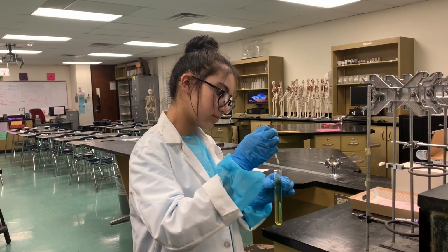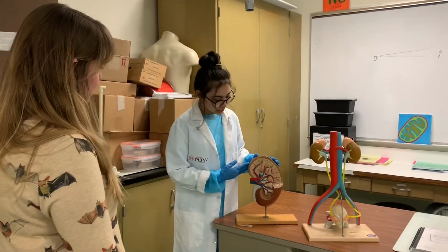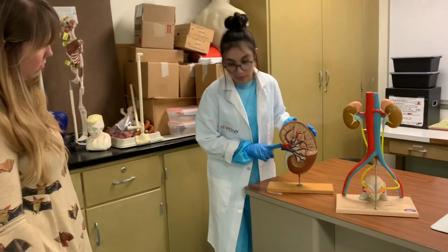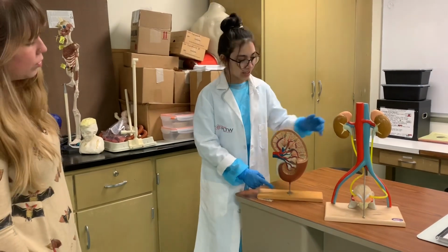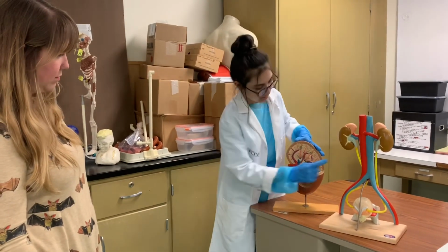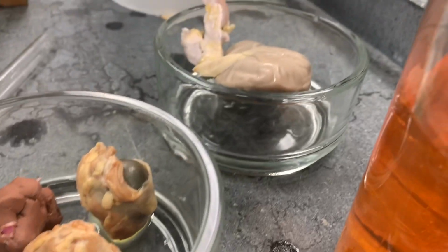Once tissue has been fixed, it can be grossed, or cut up into representative samples, and placed in plastic trays called cassettes. These cassettes run through special machinery that hardens them, either by flash freezing them or infusing them with wax, before a pathologist would cut them into thin slices only 1 cell thick for microscopic analysis. Here is where that process begins.